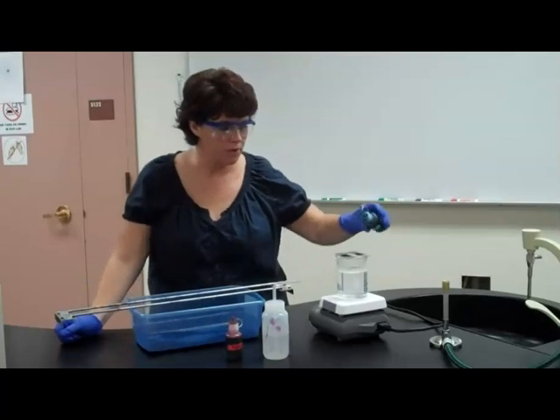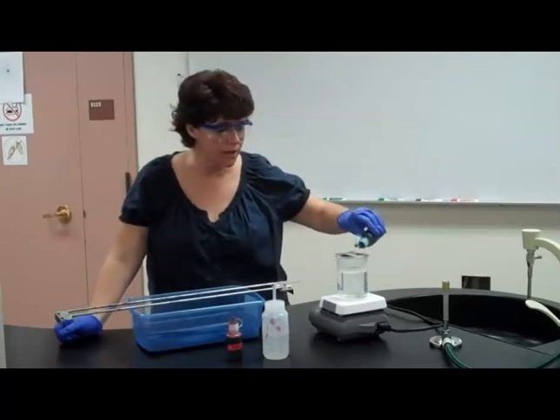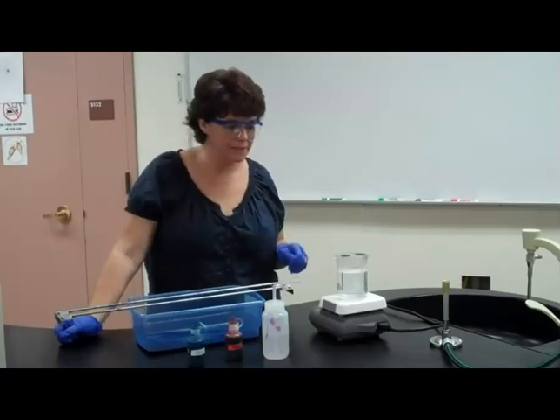Remember to watch it. So don't just walk away and come back 5 minutes later. You want to watch it. If it starts to dry out, you add more stain. So that's going to steam for 5 minutes.